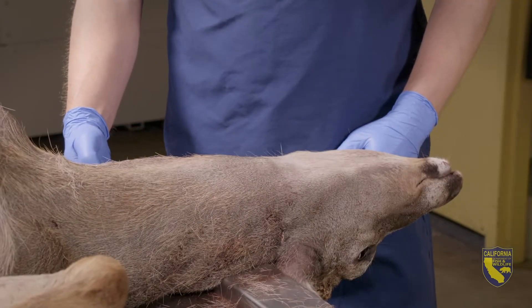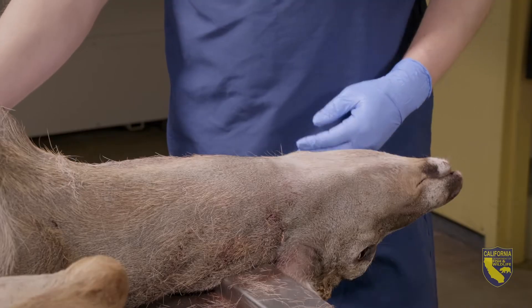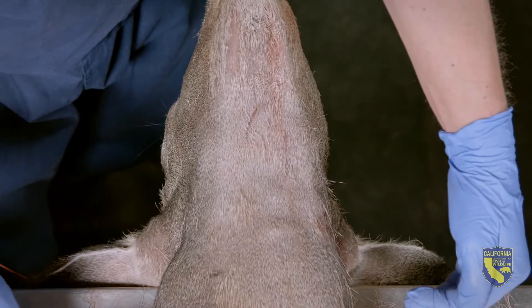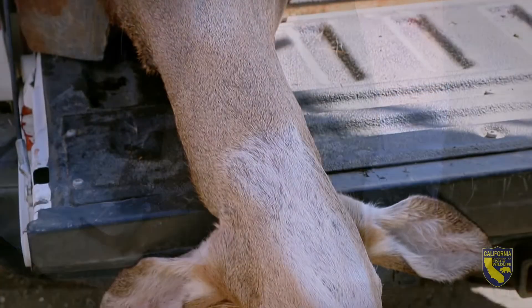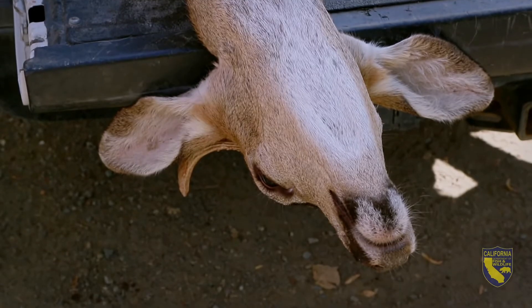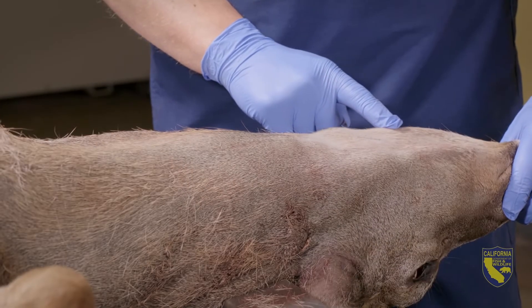Removing the lymph nodes involves cutting into the neck. To do this, position the deer on its back with its head and neck fully extended. If the deer has antlers, you'll want to position it so the ears and the antlers clear the table or truck bed. Next, let's identify landmarks for making your cut.